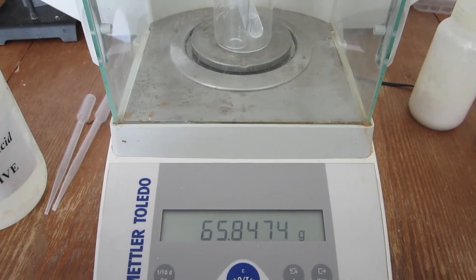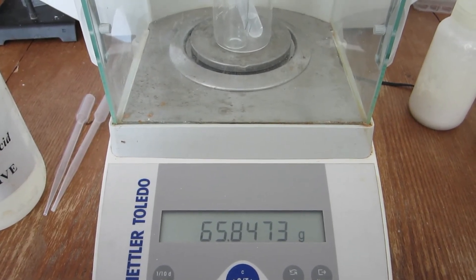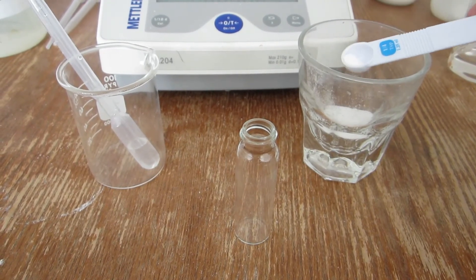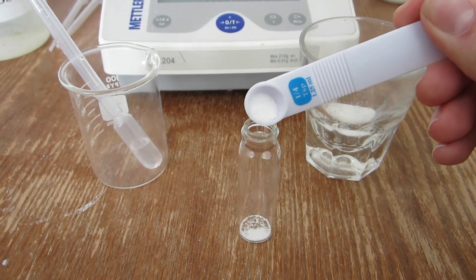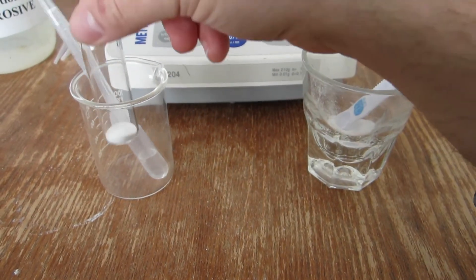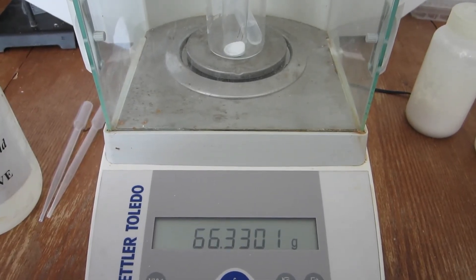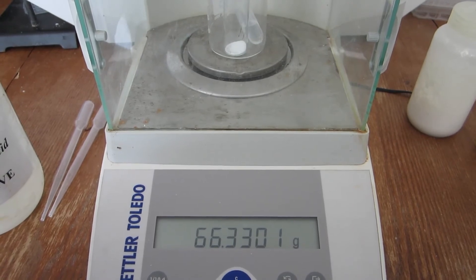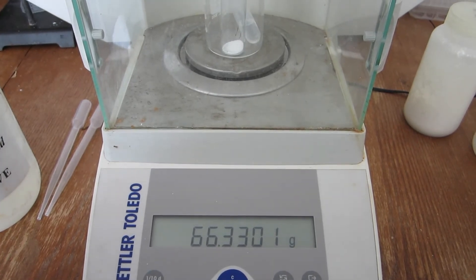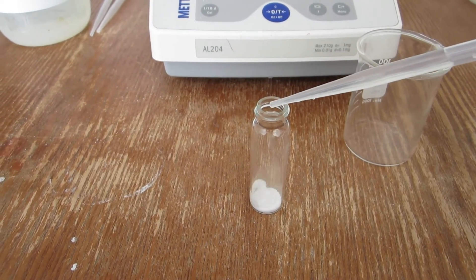For the second trial, the mass of the beaker, vial, and acid is displayed. As with the first trial, a small amount of carbonate is added to the vial. The combined mass of which is then recorded. For the second trial, the combined mass of the sample, vial, acid, and beaker is displayed. The acid is then slowly added to the carbonate sample.